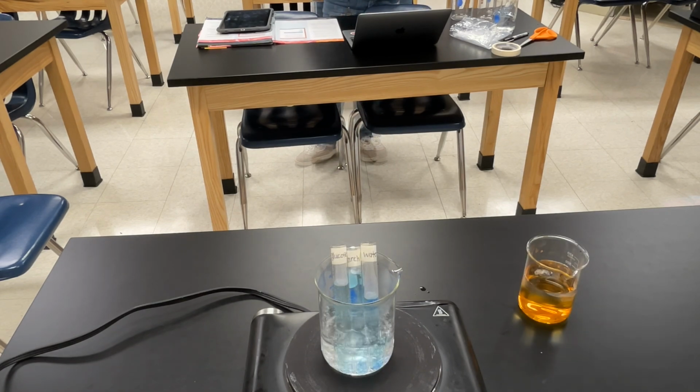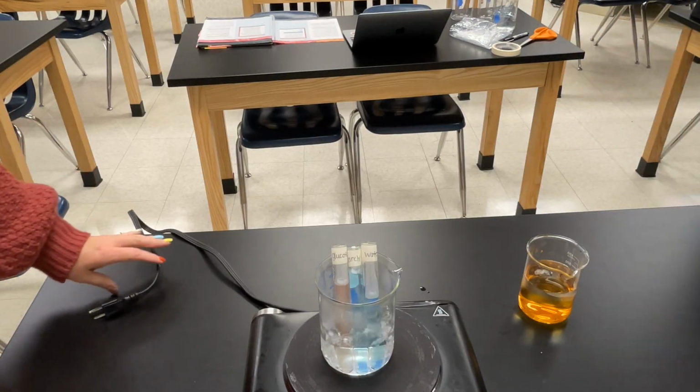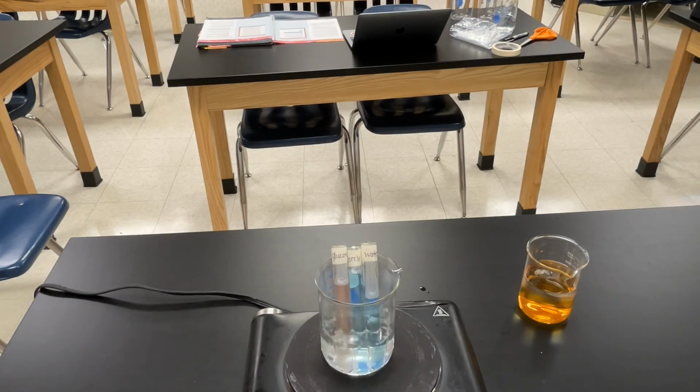Let's focus on the beaker and the dialysis tubing. This is where we will be testing for iodine. You may have noticed that as we heat up the test tubes and wait for a change, we prepare a beaker with the dialysis tubing in it. Inside the dialysis bag is a mixture of starch and glucose. The beaker contains water and iodine, so it turns brown. Record any observations in the change of color on your observation sheet.